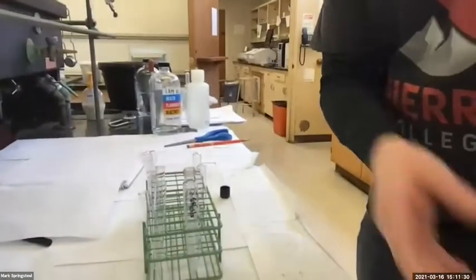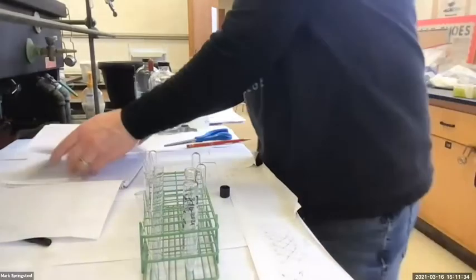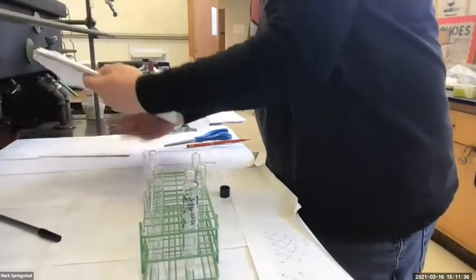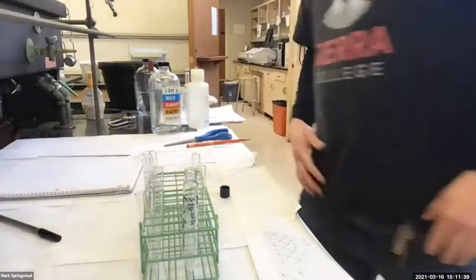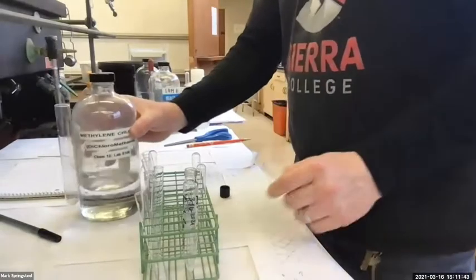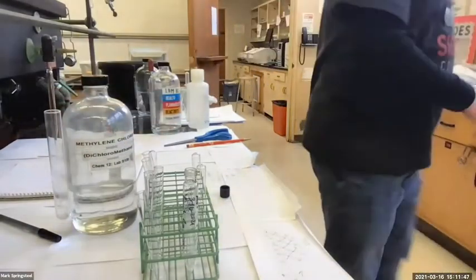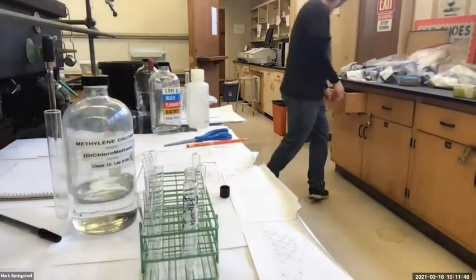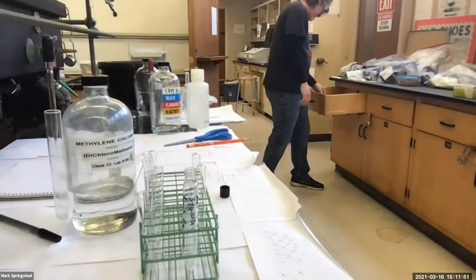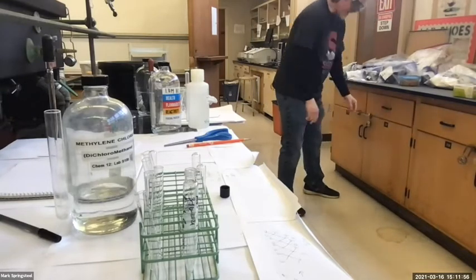First, I'll add some methylene chloride to this. This is my benzocaine. Then I'll start drawing it out, and we're going to look at the structures, and you're going to say, do this, do that. So I've got some methylene chloride here. Remember, methylene chloride is a dense organic solvent, non-flammable, which is weird. And it's going to usually be on the bottom layer. I've never seen it go on a top layer because of the density.